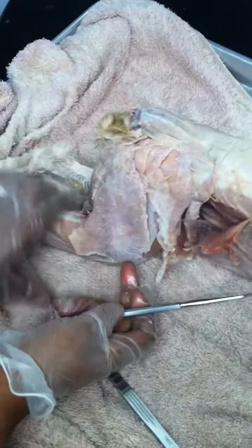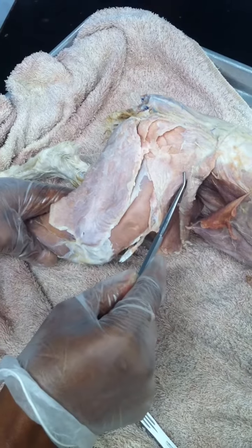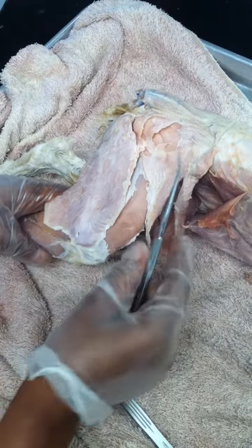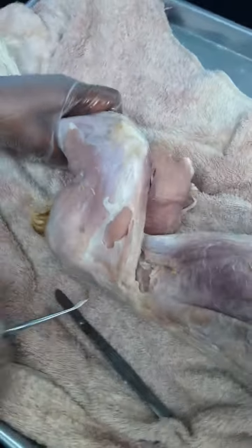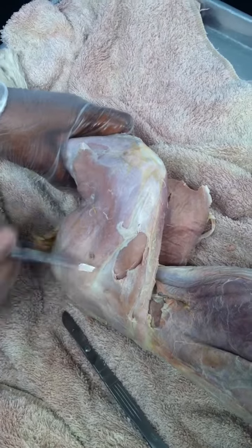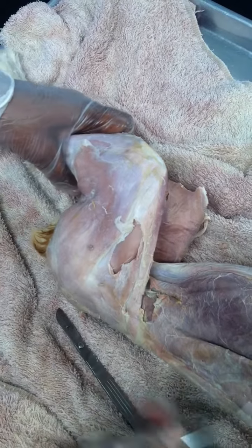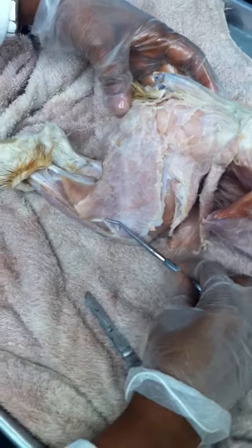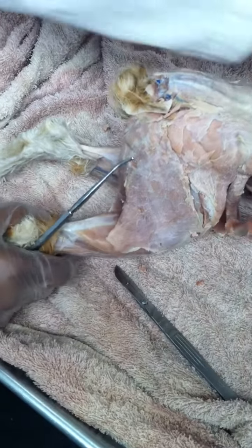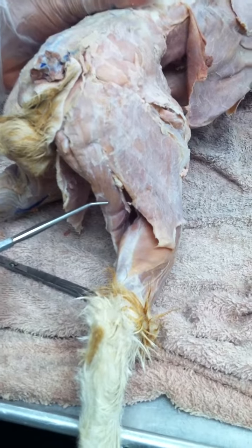Towards the thigh, or towards the medial side, that is your tensor fascia latae. It's a muscle that has fascia attached to it. If I can show you on this side, that's the muscle here, and it has fascia. This is some of the fascia that's still attached to it. Okay, so that's the tensor fascia latae. Biceps femoris. Right next to the biceps femoris is your semitendinosus.